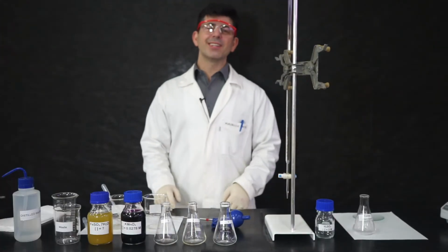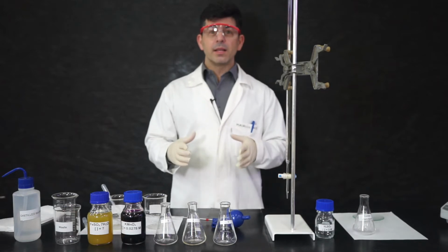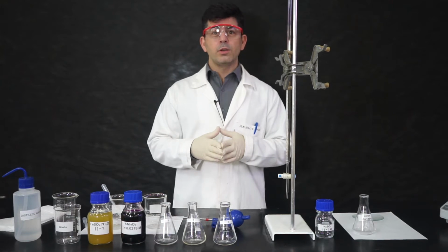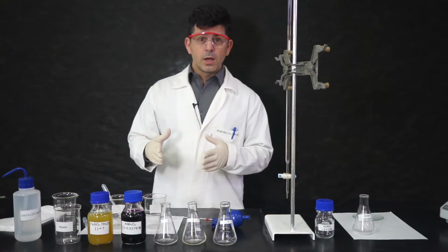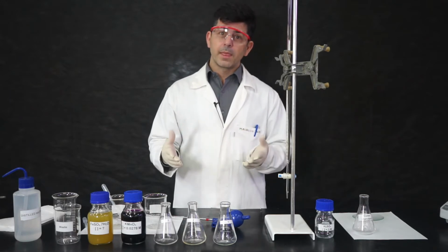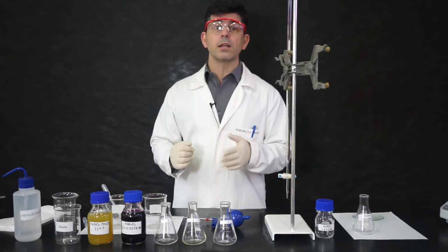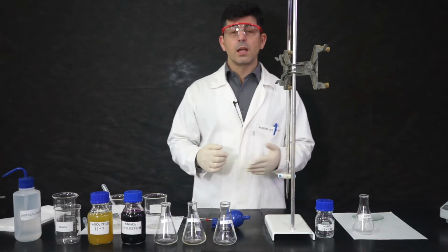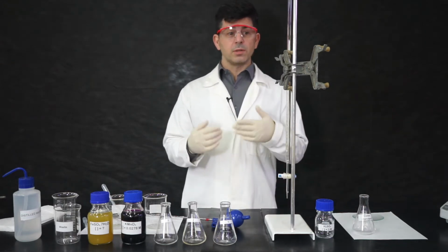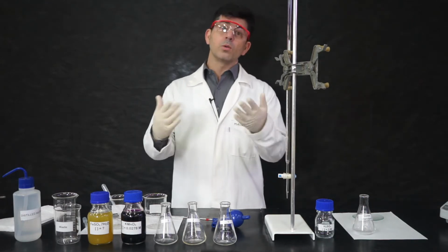Hello, IB Chemistry students. Today we are in the lab to do an analysis of a rock that is rich in iron. Your job today is to conduct an analysis where you will discover the percentage of iron in this rock. We're going to use the strategy called redox titration. The iron can be oxidized by potassium permanganate, and through this titration we will be able to determine its percentage.